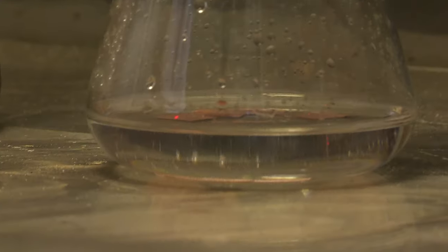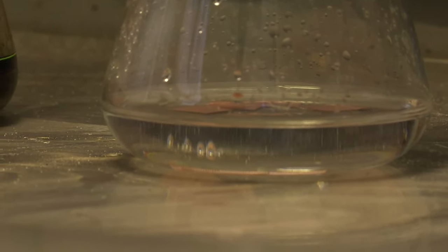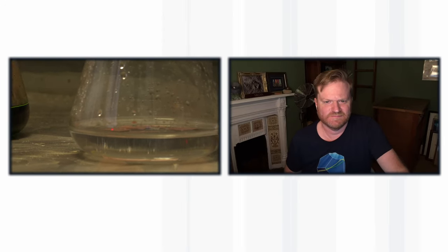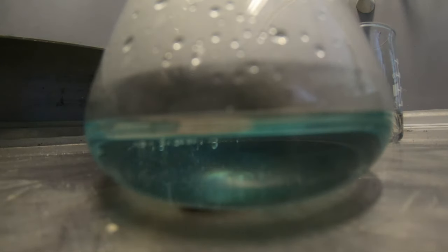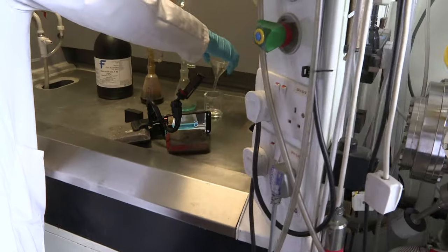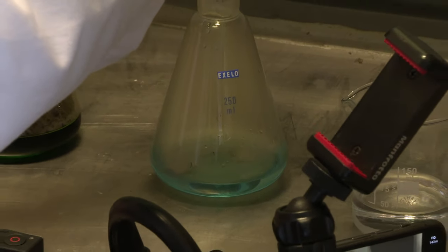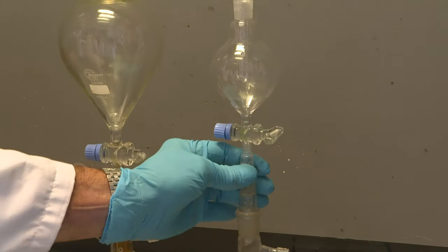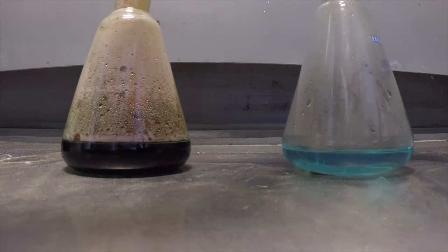On the other hand, the dilute reaction goes a lot slower. The dilute reaction was, in fact, so slow that Brady wasn't convinced anything was happening. But then it did start to get going, and the solution started going a rather pale blue with some bubbling. Neil decided to jazz it up by adding a bit more acid, so it went rather more concentrated. Then the reaction went much better, the solution went to much darker blue, and there were a few traces of brown gas, that is NO2. But the dilute reaction produces NO, rather than NO2.